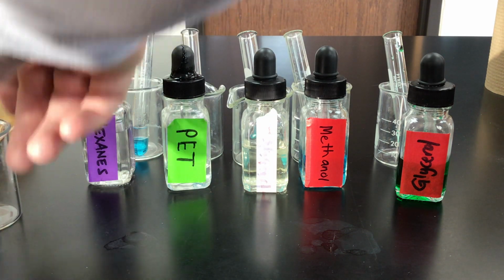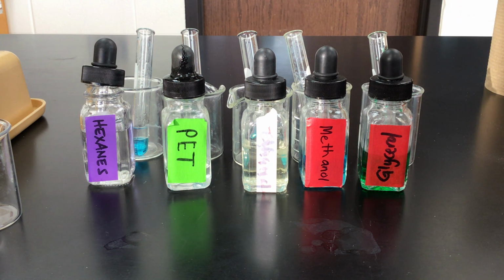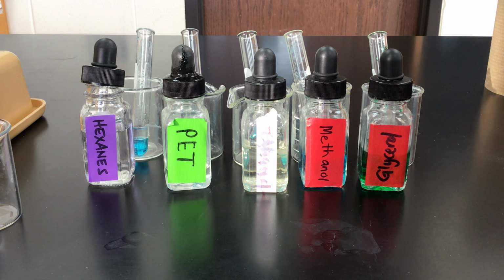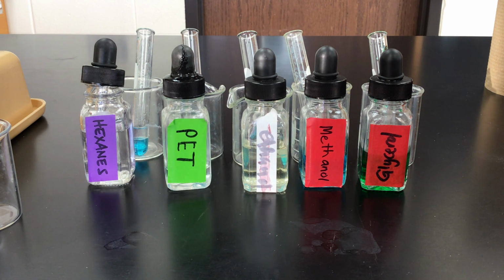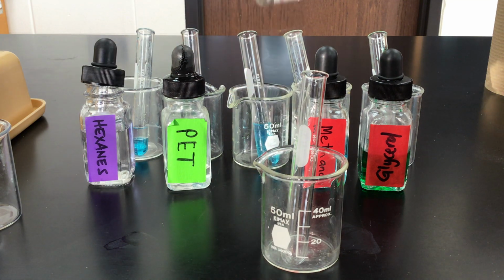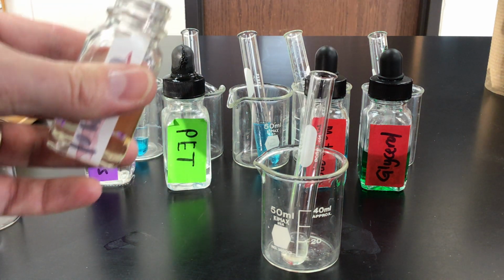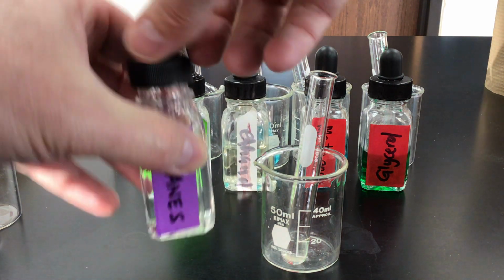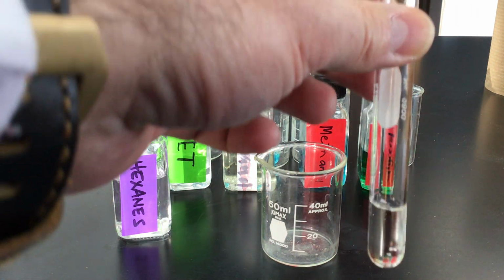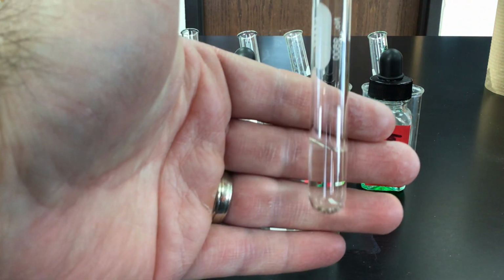Now, what we would also do in our lab is also maybe look at and mix the other chemicals like the glycerin, the methanol, ethanol, mix those in hexane and see if they reacted as well. What we're going to do, however, is shorten this up a little bit. And we'll try some ethanol, and we're going to see why in our lab analysis later. I'm going to take the ethanol, put that in this test tube here, and mix that with some hexane and see what happens. All right, so I've got my ethanol in the test tube, adding some hexane. All right, and no layers.